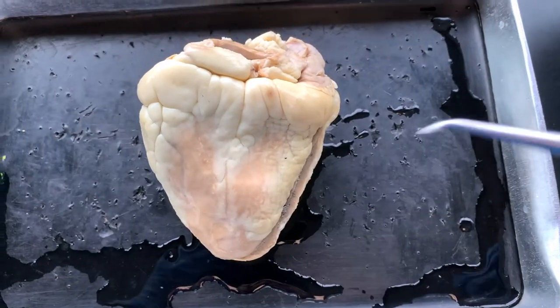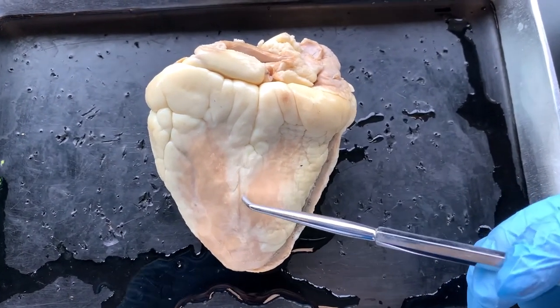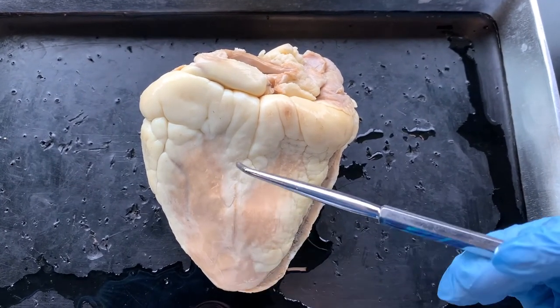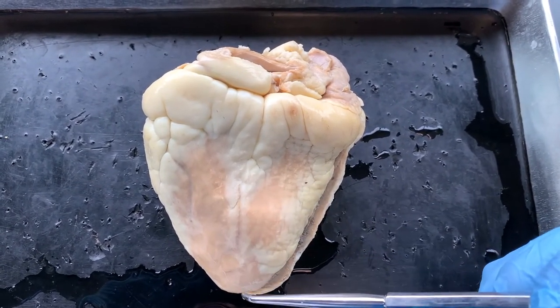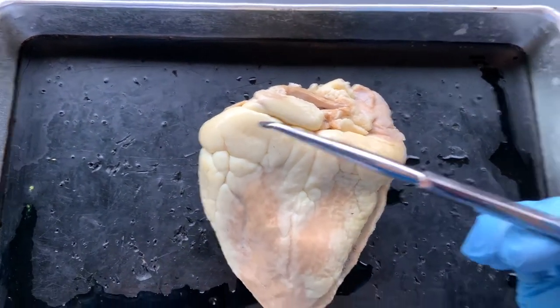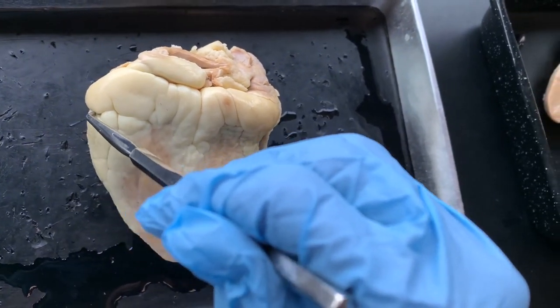And you can see here a nice example of the posterior interventricular sulcus. We know that the coronary vessels would be under that fat pad. The coronary sinus and the atrioventricular sulcus is here.